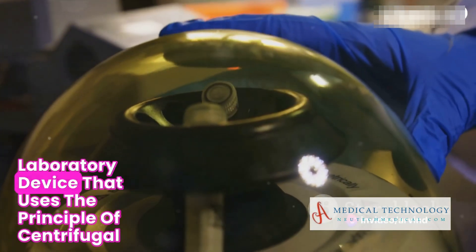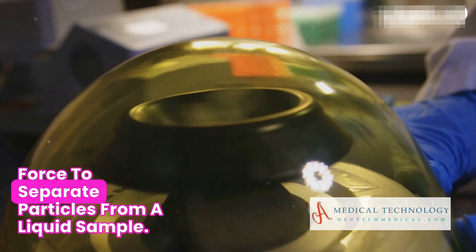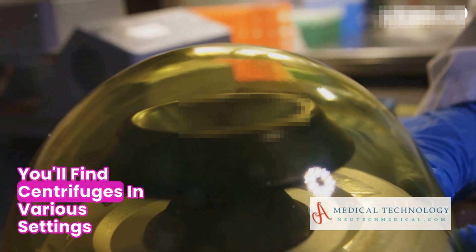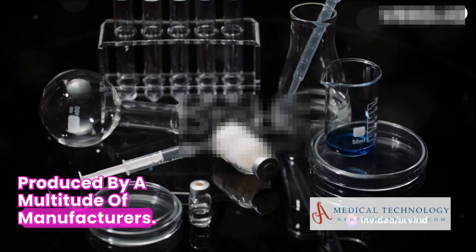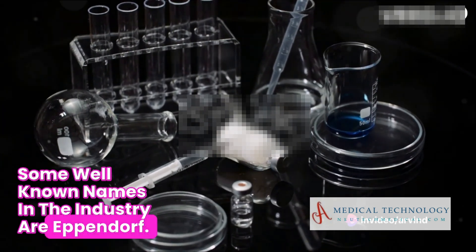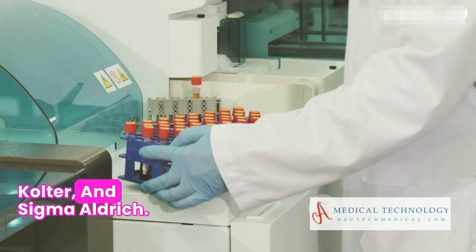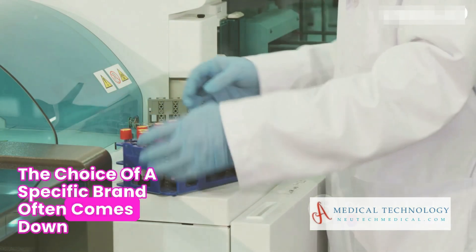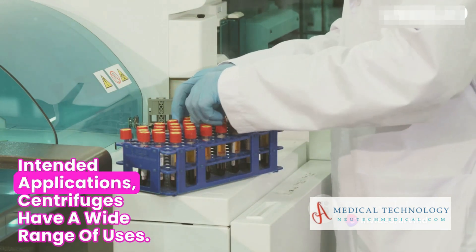It's a laboratory device that uses the principle of centrifugal force to separate particles from a liquid sample. You'll find centrifuges in various settings, produced by a multitude of manufacturers. Some well-known names in the industry are Eppendorf, Thermo Fisher Scientific, Beckman Coulter, and Sigma Aldrich. The choice of a specific brand often comes down to the scale of the laboratory work and the intended applications.